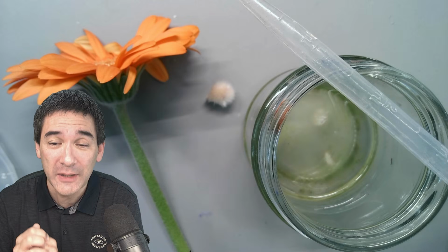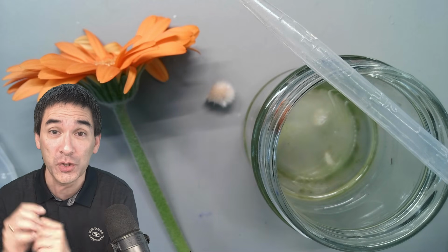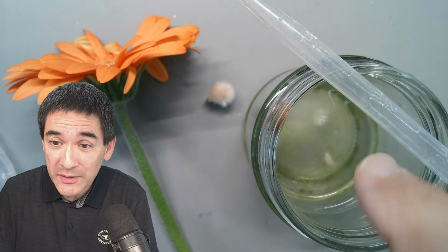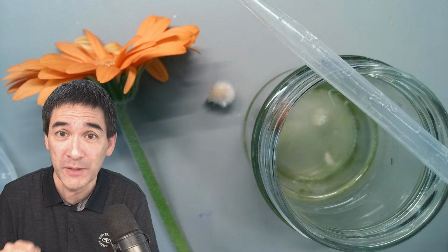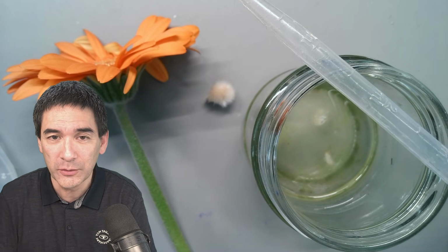Today I would like to do the following three things. I would like to put three things under the microscope. First of all, a little bit of a follow-up from what we started last week. This here is a water sample where I started to grow some ciliates. So we're going to start with this first. There are a couple of ciliates in there, and I would like to show them to you.